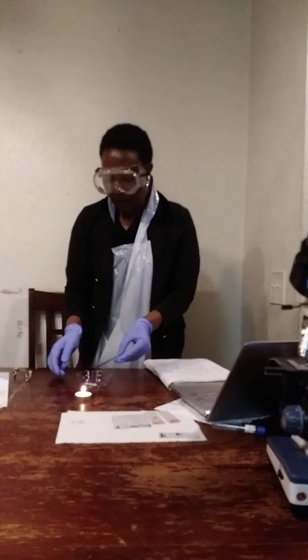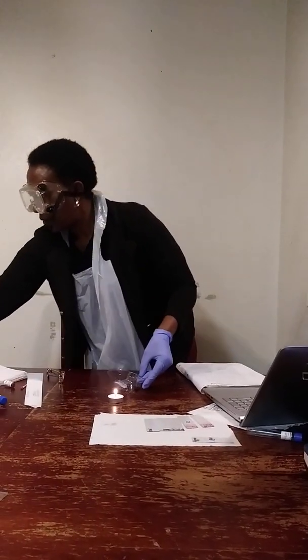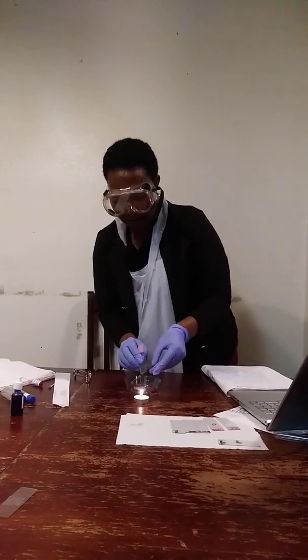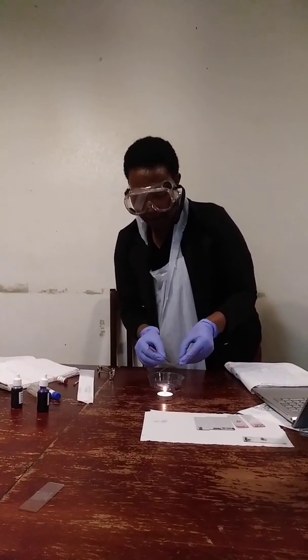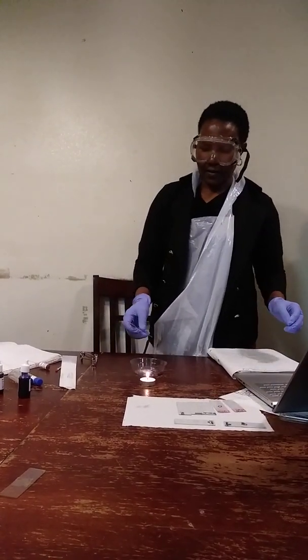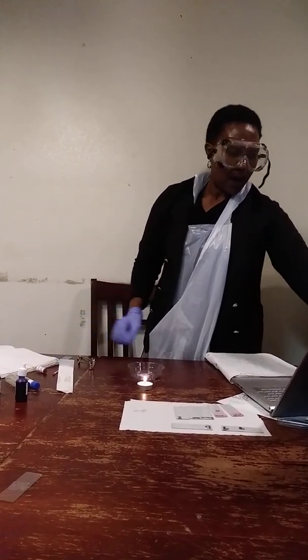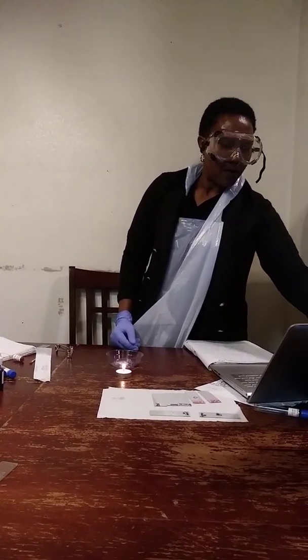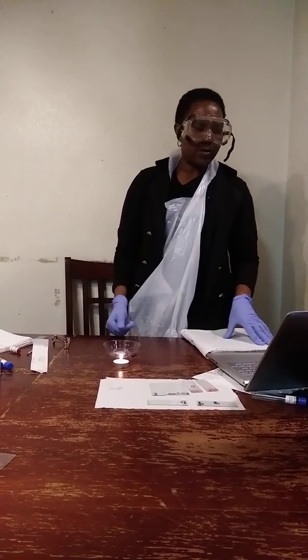And I'll put this on 30 degrees and I will scatter the stain that is there with another slide. It is done. And so I will be able to view the images on my microscope.